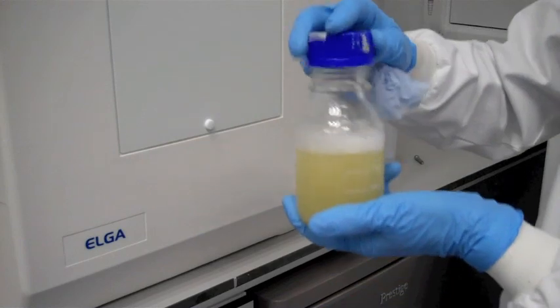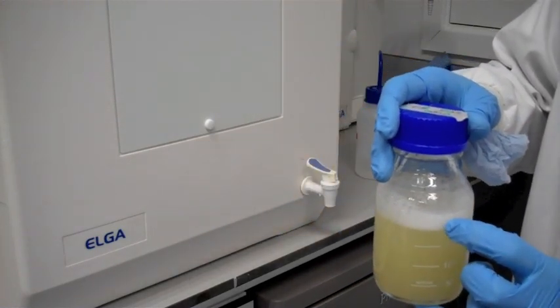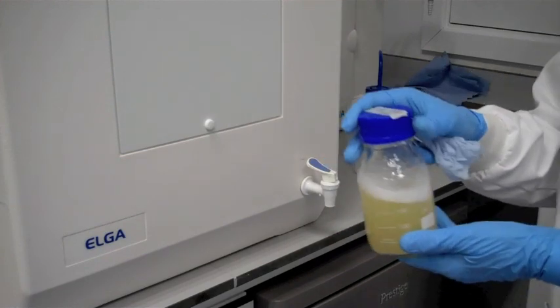So that's now, as you can see, on the 200 milliliter mark. There. And that's it. That's now ready to be autoclaved.